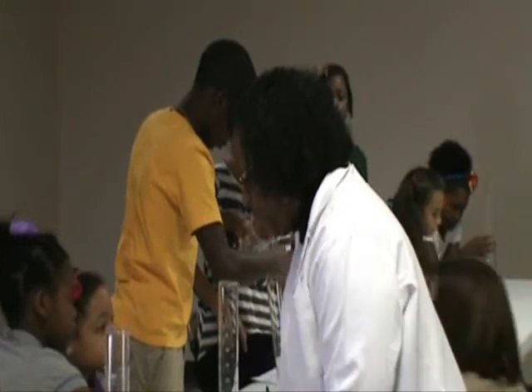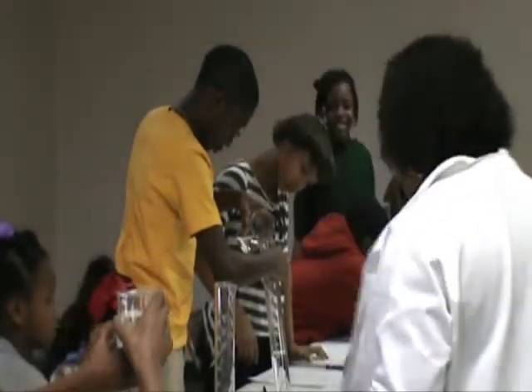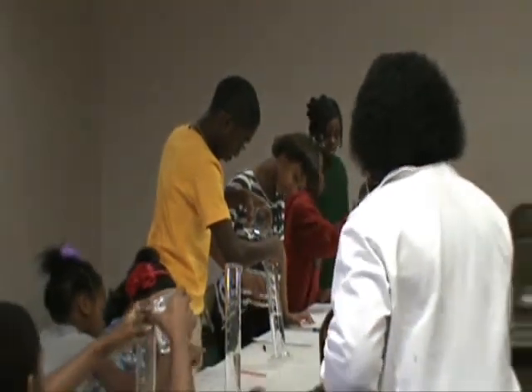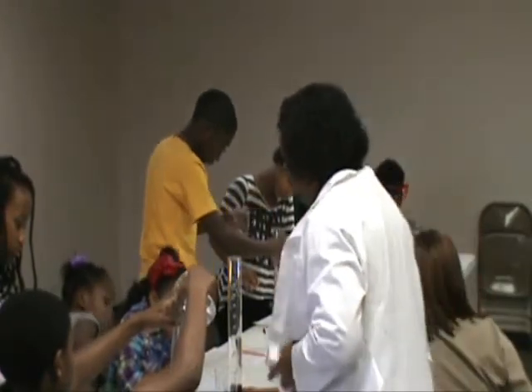Okay, eye level. You're going to read it for me. Yes, I'll be right with you. Give me 1 second. Come on, girls. Go to eye level and look. Okay, everybody, listen to me. Give me 3 claps, quick.